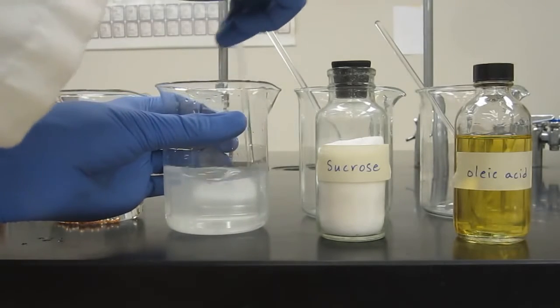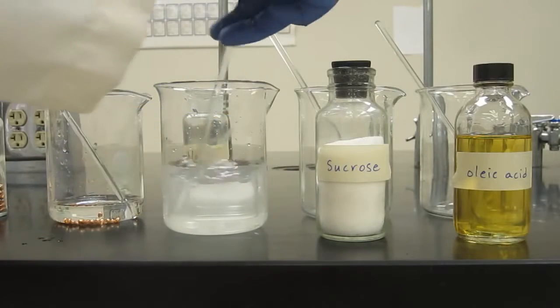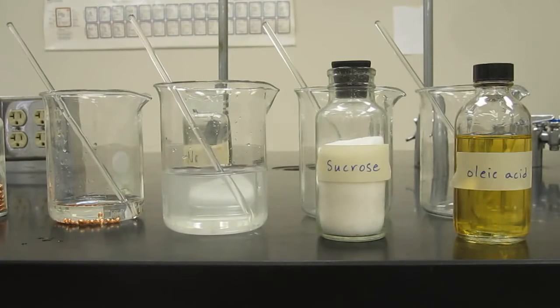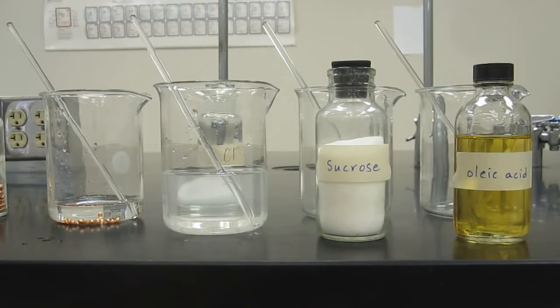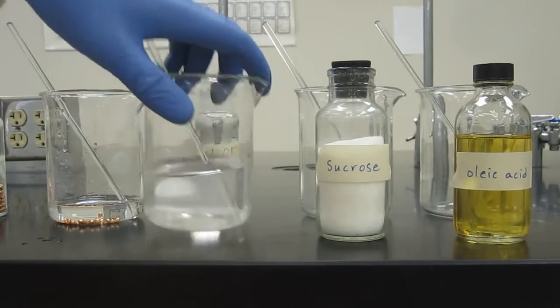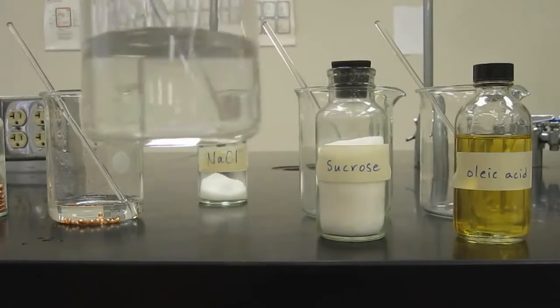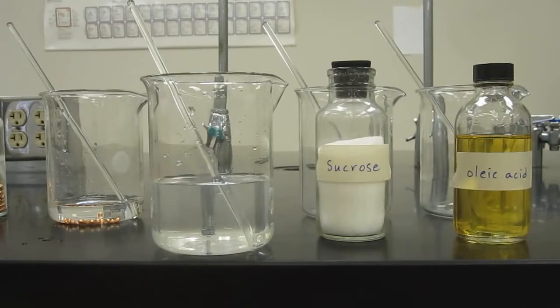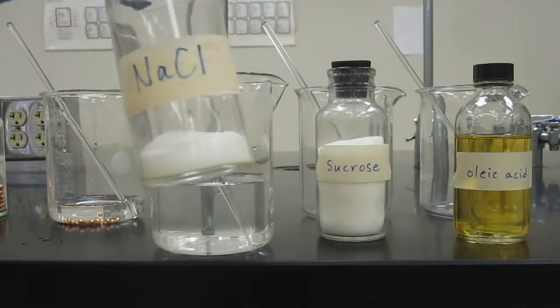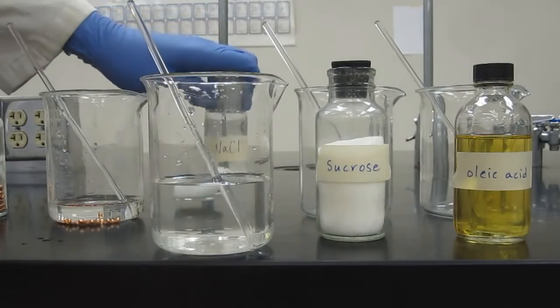So you can see, hopefully now, this is an ionic compound, and this is typical of ionic compounds. Some ionic compounds won't do this, and we'll talk about those later when we get to the solubility chapter. But you can see that we've made a mixture that looks quite different than the 2 components individually. It looks very much like the pure water, which is the solvent, which you'll learn about later, but it looks very little like sodium chloride. But if I were to taste it, it would taste a lot like sodium chloride.